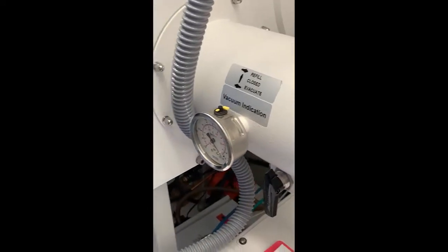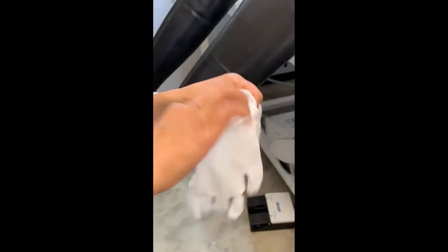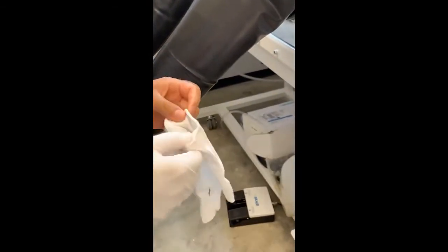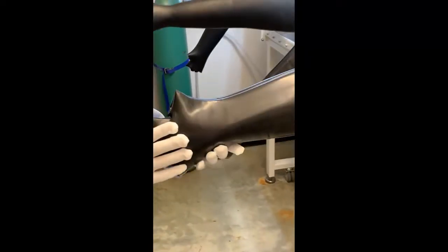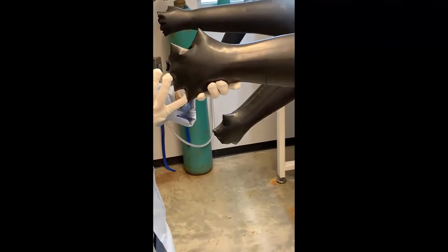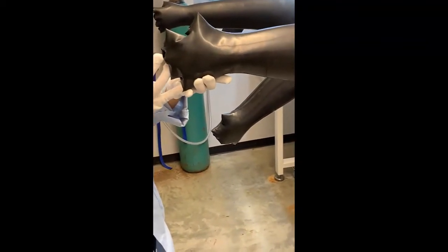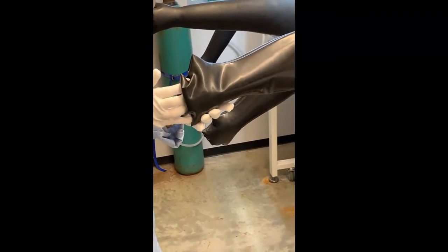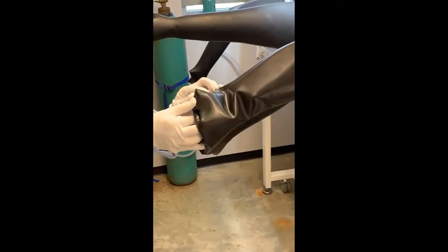The next step is putting on the white cotton gloves that must be worn any time you are going into the glove box, and then putting on these black thick gloves. The easiest way that I've found is if you put your pinky in first, and then slide the rest of your fingers in.